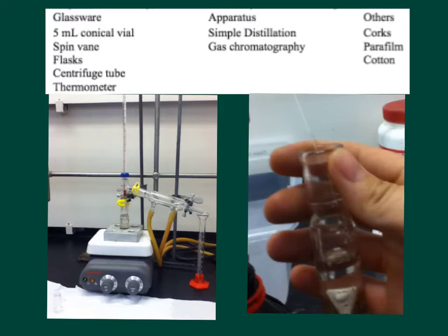Another thing I wanted to say was that in our simple distillation apparatus, we're going to be connecting to our water-jacketed condenser this tubing into our water supply and this one down the drain. We're going to be passing water through the inside of the water-jacketed condenser in order to condense our vapors into the centrifuge tube which are being heated up here. The purpose of this is because we're trying to heat up our alcohol and make it go E1 reaction.